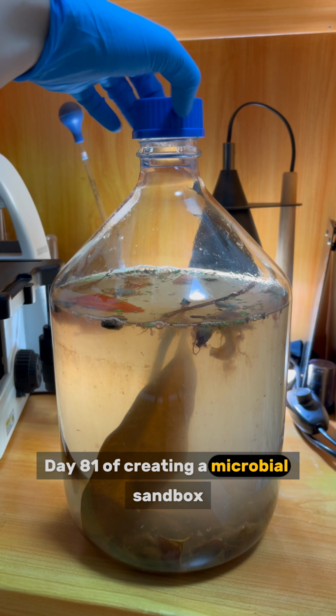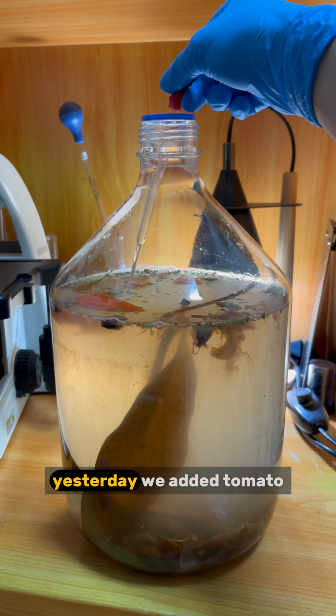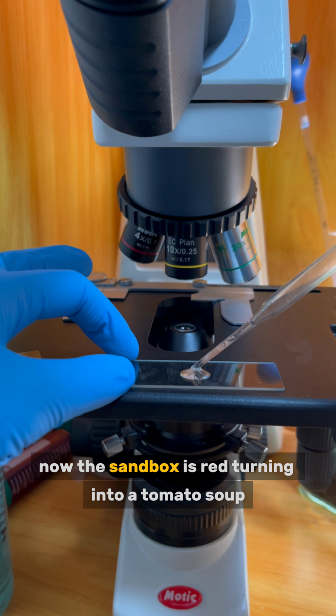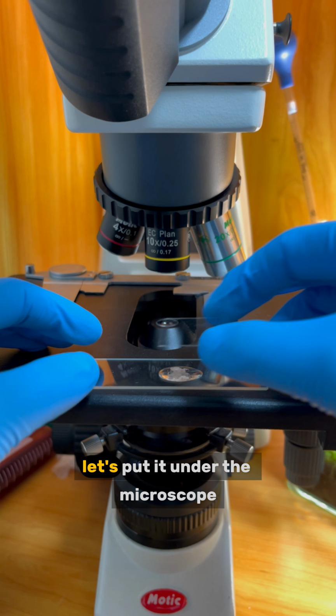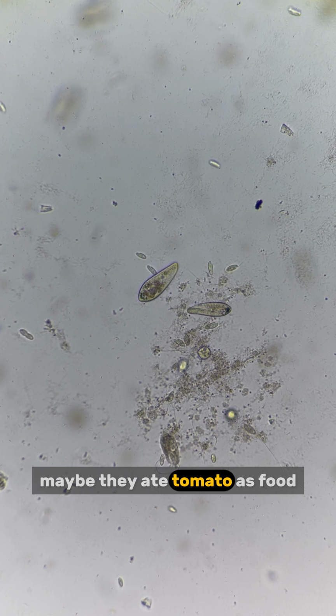Day 81 of creating a microbial sandbox by adding random stuff and observing it under the microscope every day. Yesterday, we added tomato. Now the sandbox is red, turning into a tomato soup. Let's put it under the microscope. I see some red substances inside Paramecia. Maybe they ate tomato as food.